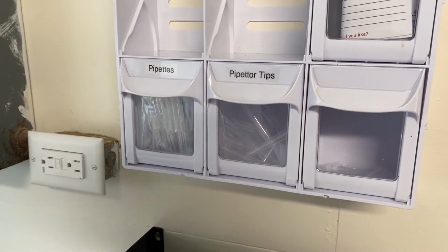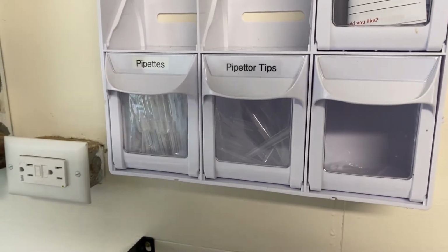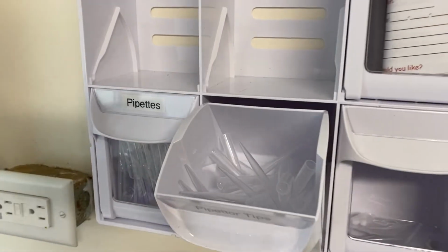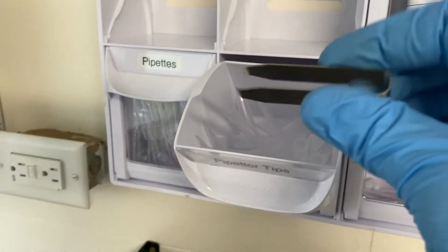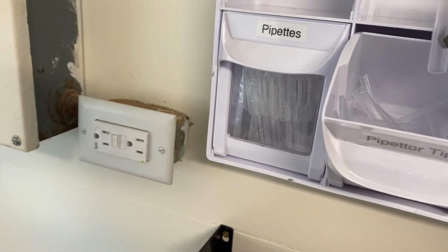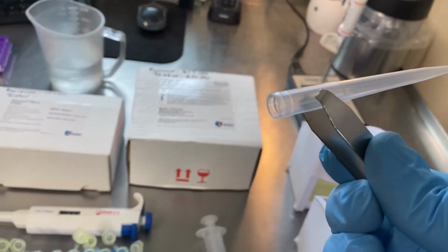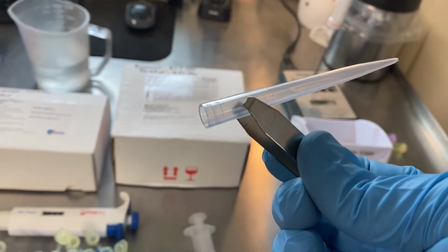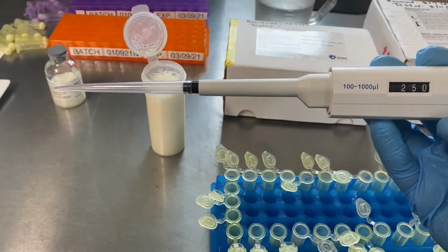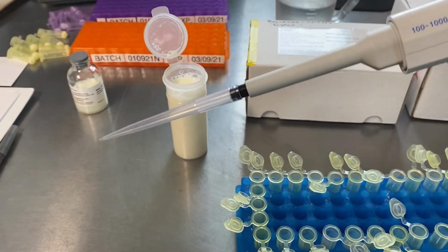In order to start pipetting over into our sample vials, we need to put a pipetter tip onto our pipetter. Inside of our container here is the pipetter tips and this little set of tweezers. We're trying to handle these as little as possible, because this is where a point of contamination could happen. If we've handled something with antibiotics, we could potentially contaminate the rest of the stock. So we're going to take this tip and put it onto our pipetter. So we've got the tip on the pipetter. It doesn't take a lot of force. You just push it on gently. It will hold on its own.